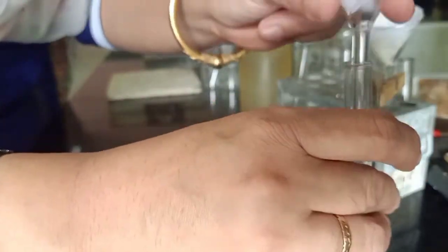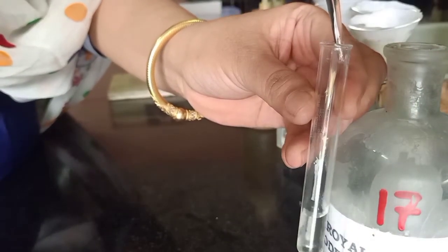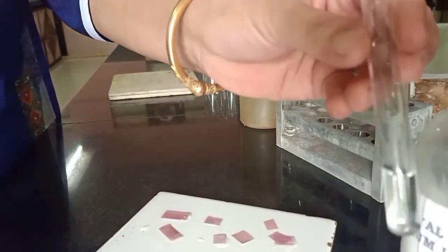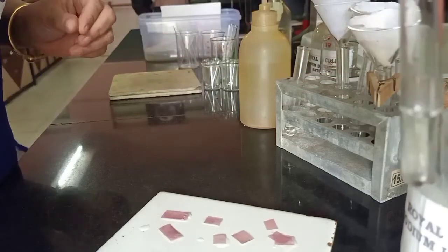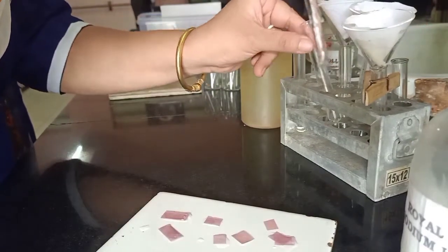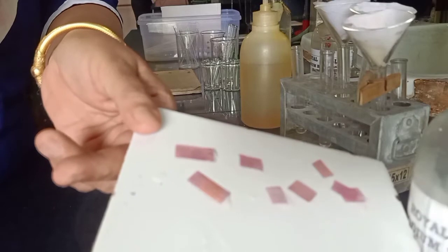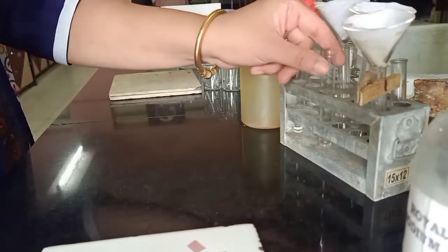We have got the filtrate and let's check for re-precipitation. Re-precipitation of a base is done with 20% NaOH, so let's add the 20% NaOH. As you can see there is no re-precipitation taking place with 20% NaOH. Let's check the medium — we need to confirm we have added enough NaOH. This time we are checking for an alkaline medium because we have added NaOH, and the medium must be alkaline for a base to be precipitated. We will transfer a drop of this filtrate onto red litmus paper — it should turn blue.